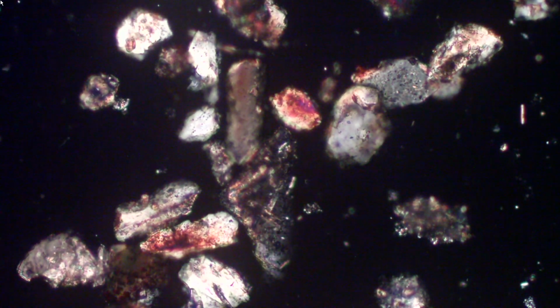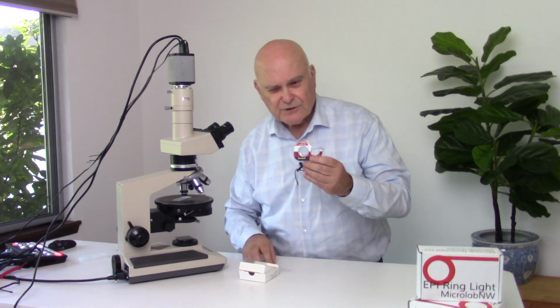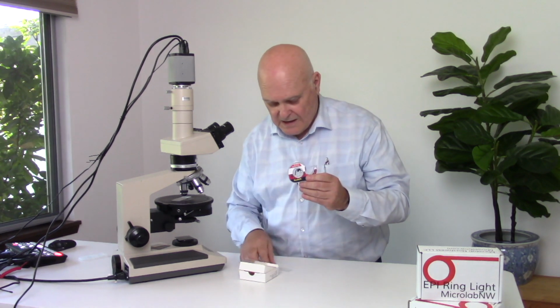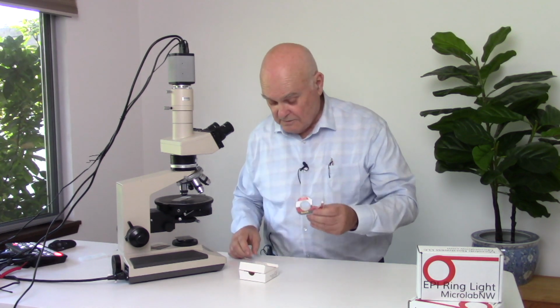So basically, that's all there is to making circular polarized light. To make circular polarized light, we use the Scotch brand clear tape in the red plaid dispenser. Put, in this case, 5 layers down. Sometimes it's only 4. It depends on the stress that's in the plastic here.